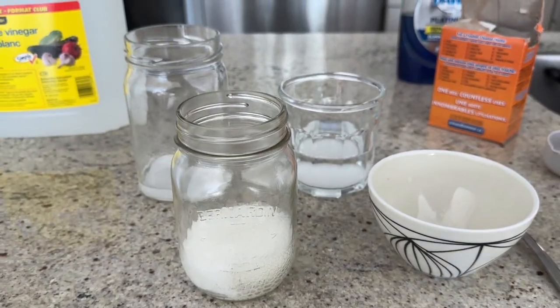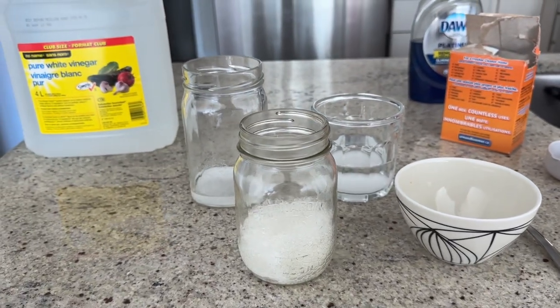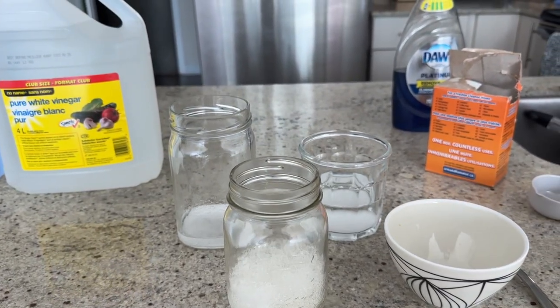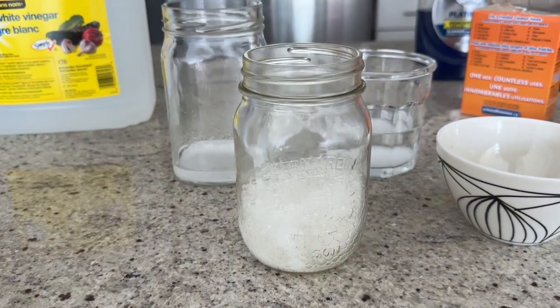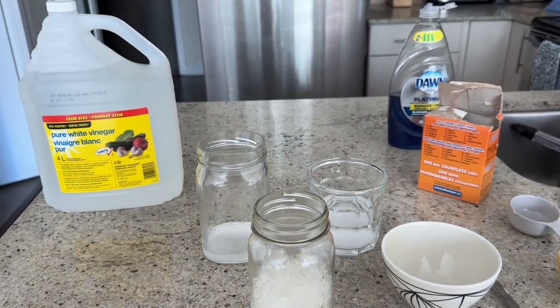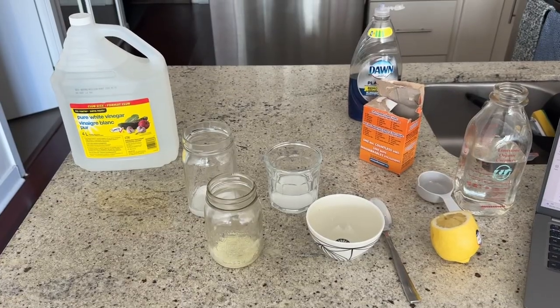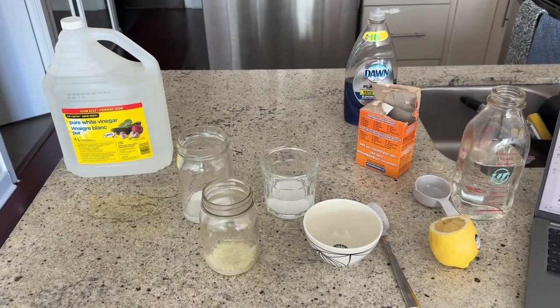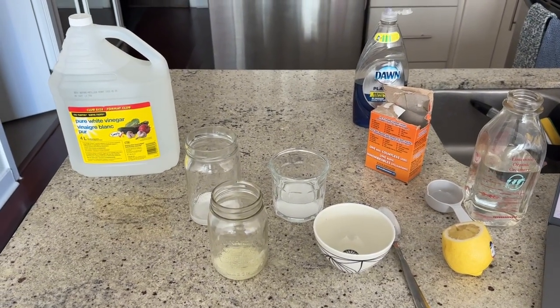So as we can see, it is bubbling, but not as much as it did when combined with the vinegar reaction. So at this point, you could ask the students to compare which acid appears to react more vigorously and why. I hope you all enjoyed this experiment demonstration on acids and bases and have fun experimenting with your students.